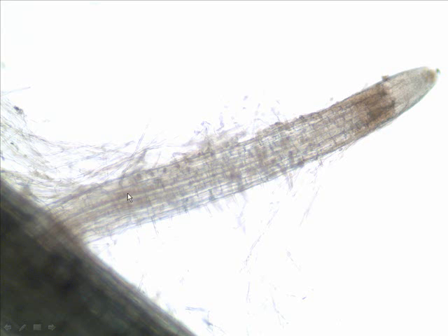By the way, is this a monocot or dicot root? So how in the world would I know? Well, I see a central cylinder forming, and we've already looked at this in lab, but central cylinders form in monocot or dicot roots. Dicot. Lastly, we see this root developing from the surface, this branch root developing from the surface of the main root, or from in the interior someplace. Well, I think we can see it's kind of coming out from the interior.